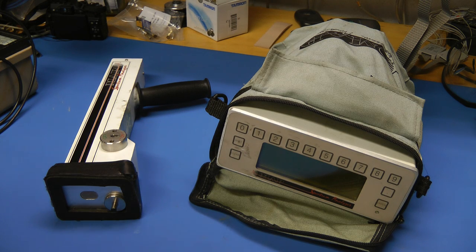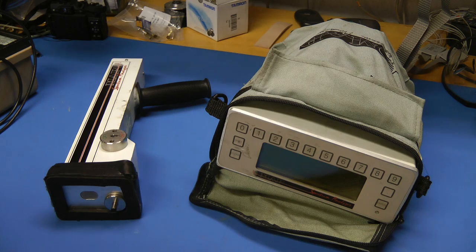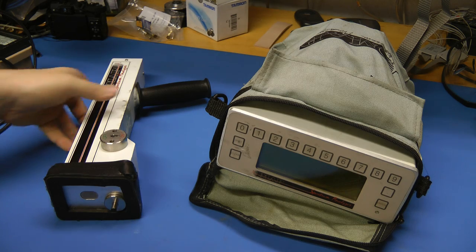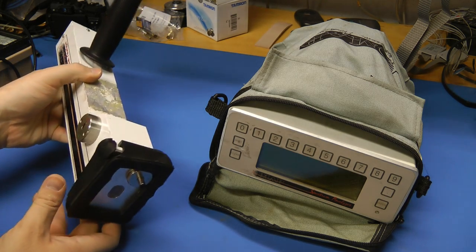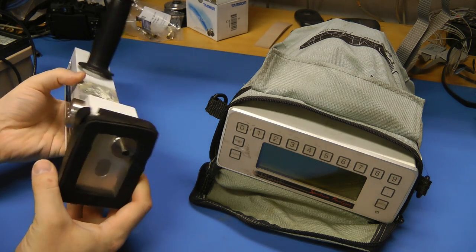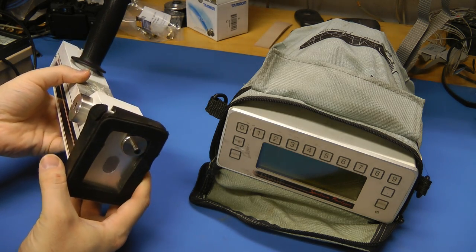Hey guys, this is a teardown of a MAP spectrum analyzer. This is an X-ray fluorescent spectrometer which was initially designed for detecting leaded paint on painted surfaces.